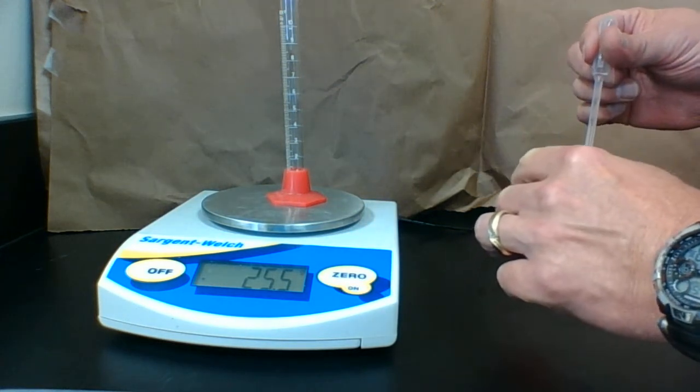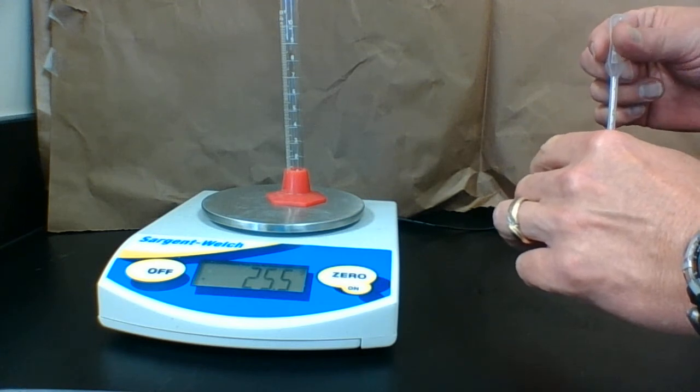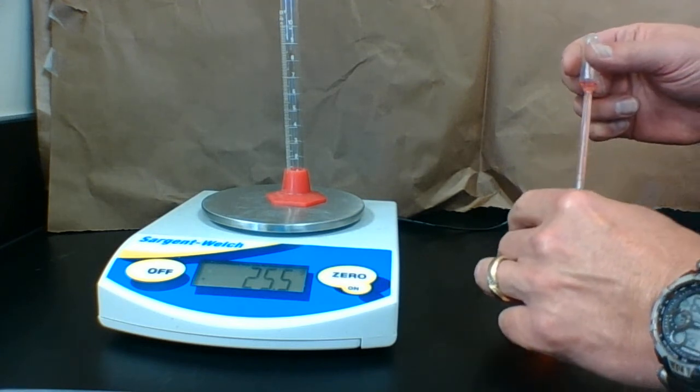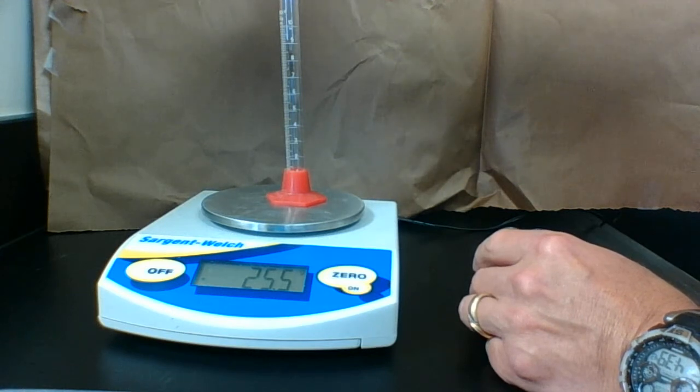Then I'm going to take a desired amount of this red solution in this pipette and I'm going to put it into that graduated cylinder. You will see things start happening.